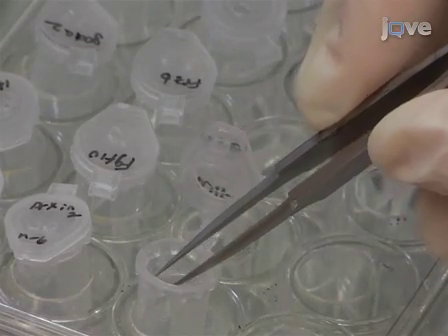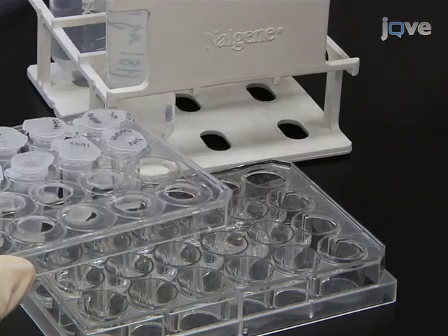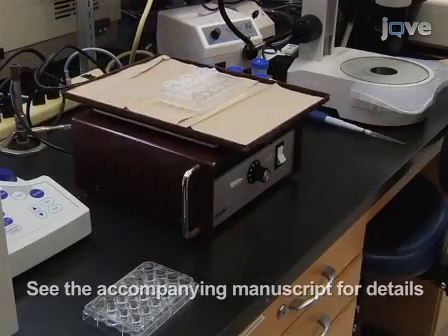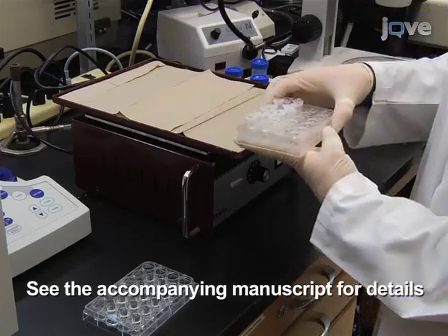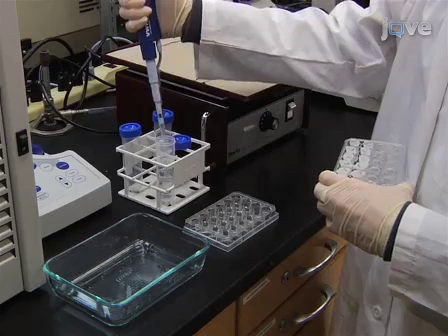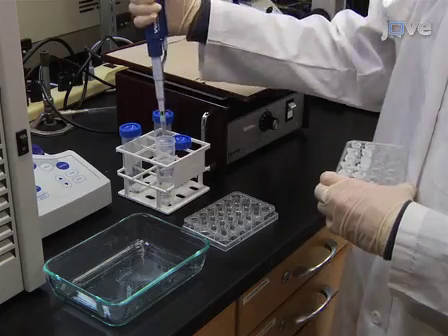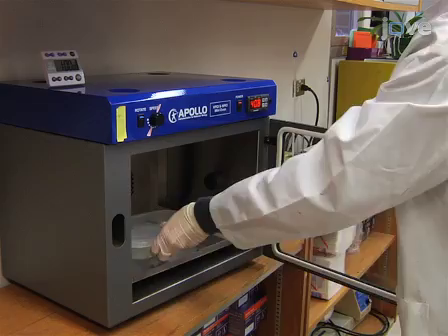Transfer tissue sections into the baskets. At room temperature with rocking, incubate the sections in 6% hydrogen peroxide with PBS-tween, followed by a series of washes with PBS-tween, an incubation with proteinase K, another fixation, and more washes. To finish preparing the samples, add 2 ml of pre-warmed pre-hybridization buffer to each well and incubate the plate inside the heated hybridization chamber for at least one hour.